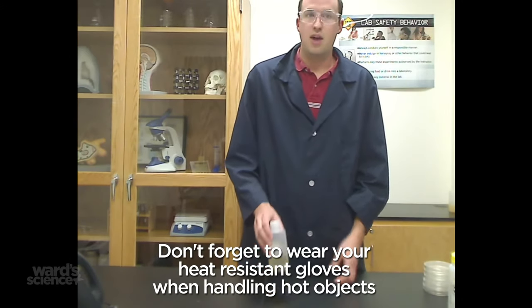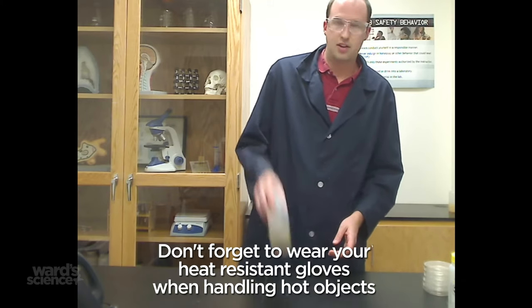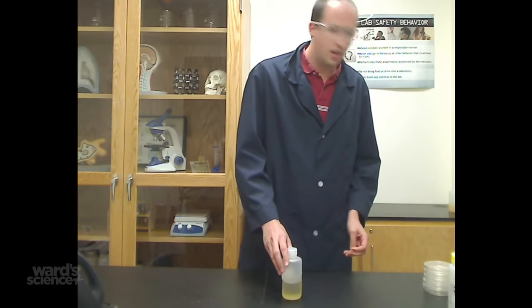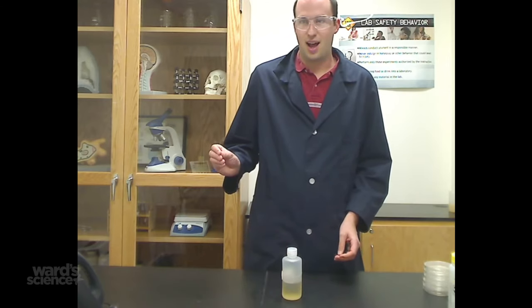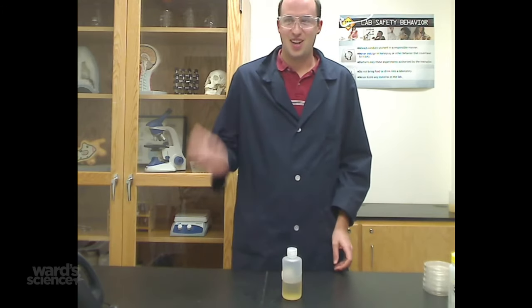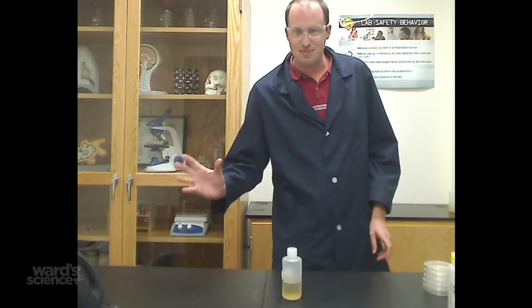And now all of my agar has melted into a liquid form, and it is very hot at this point. Hot mitts. These are my hot mitts.